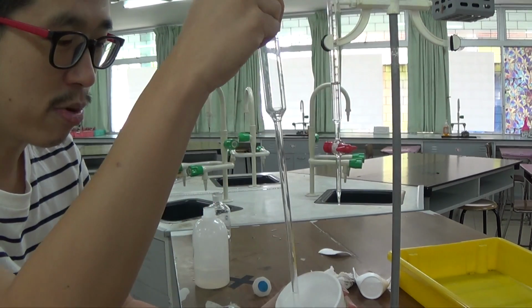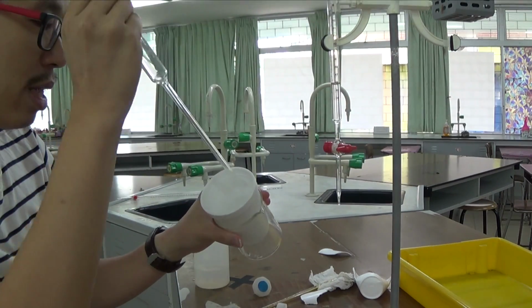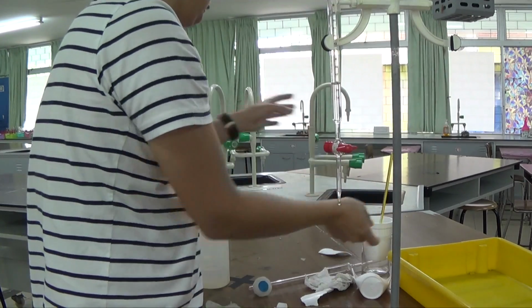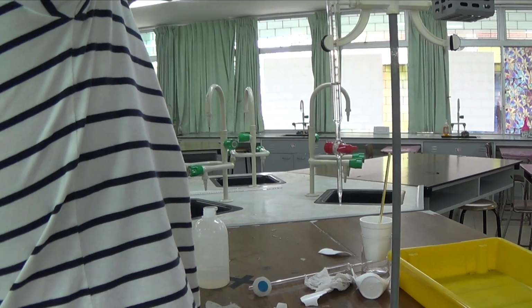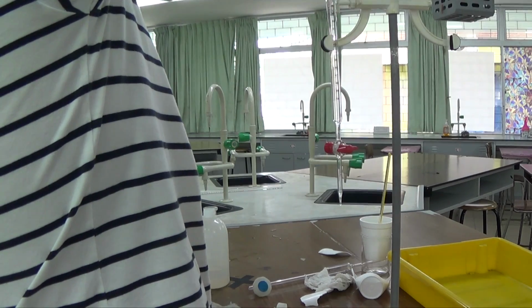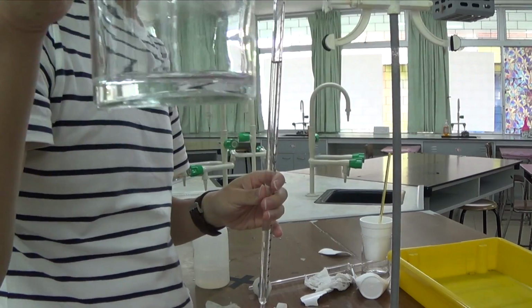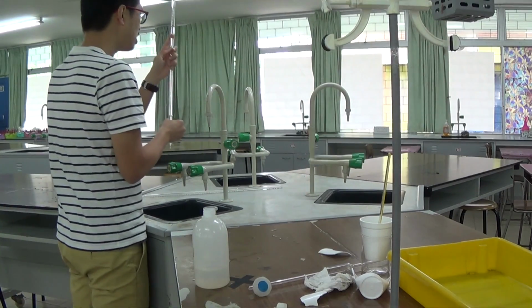Okay, I have to top up my burette as well because the last thing I'm going to do is 25.0 cm cube in here. So I need 25.0 cm cube in the burette. Instead, I have only a couple of last drops in there. So Q goes in the burette. I wonder if I have enough. Oh yeah, I do have enough, okay? But in exam they said that each student should have a specific quantity, so you don't have time to repeat any of these at all. So I'm just gonna put this down.